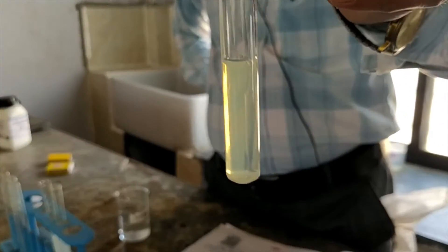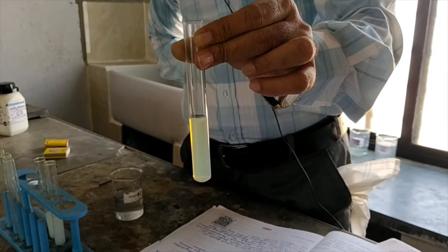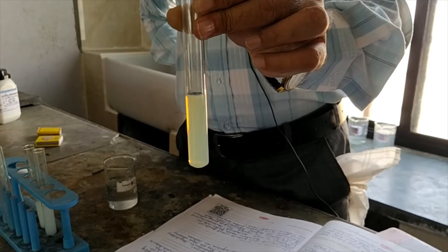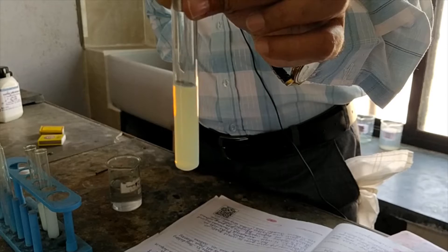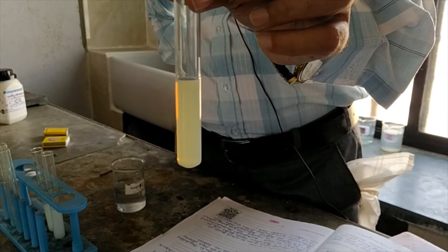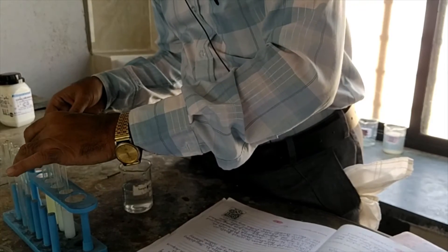Now see here — can you see it is yellowish in colour? Yes, this is yellowish in colour. Now you will notice the colour change. I will show you all three test tubes together so you can see the colour change properly. Now I will place them in the test tube stand.